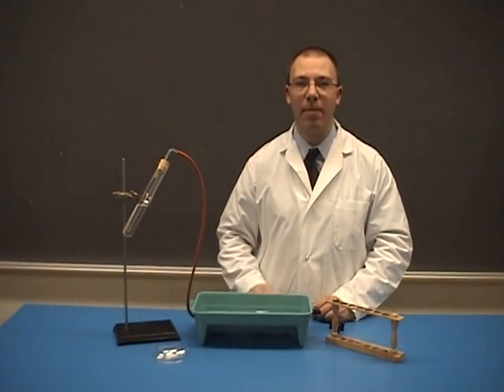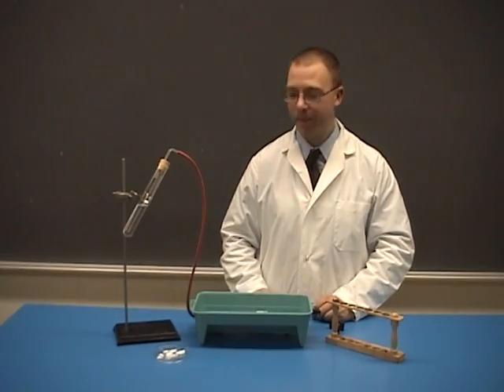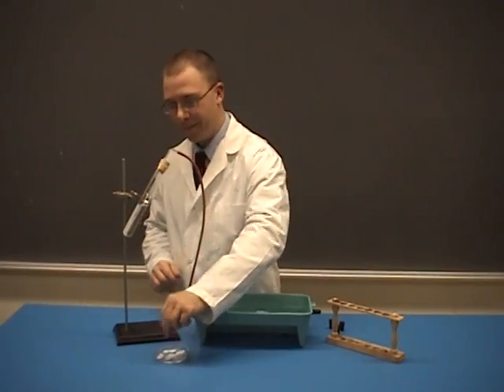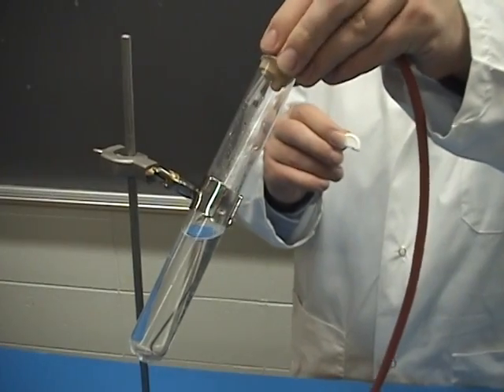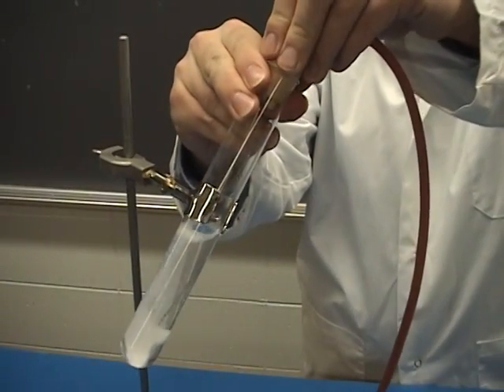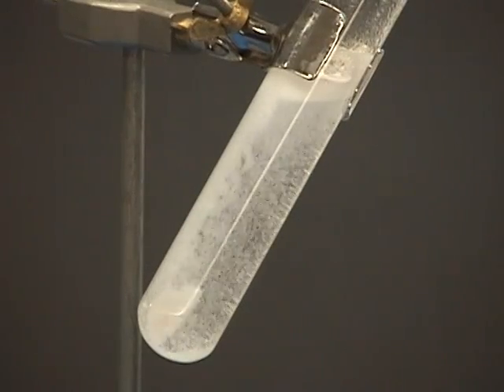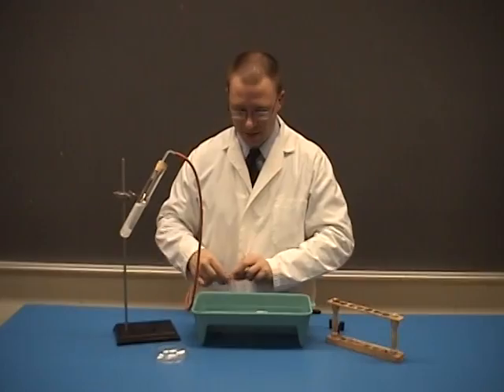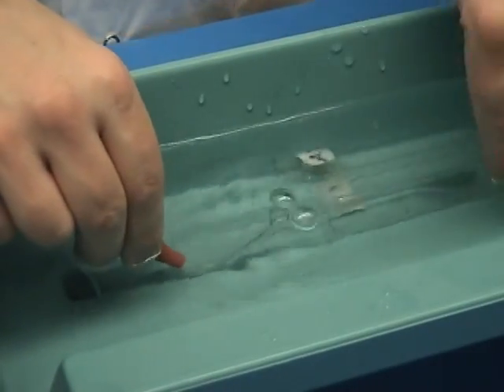Place half an Alka-Seltzer tablet in the test tube. Place the rubber stopper in place securely, and submerge the glass elbow under the water.